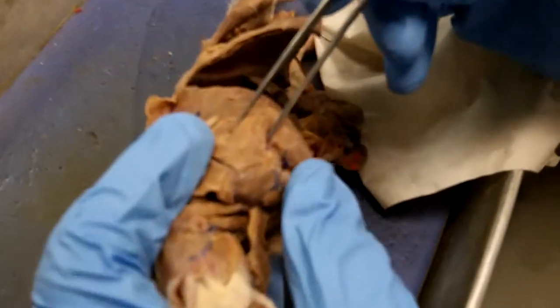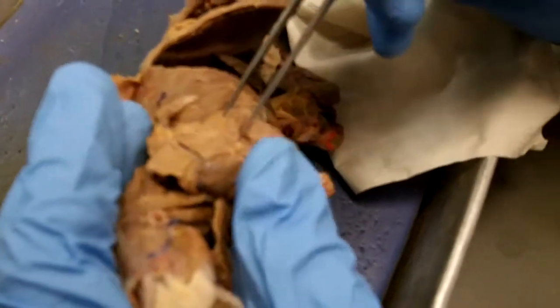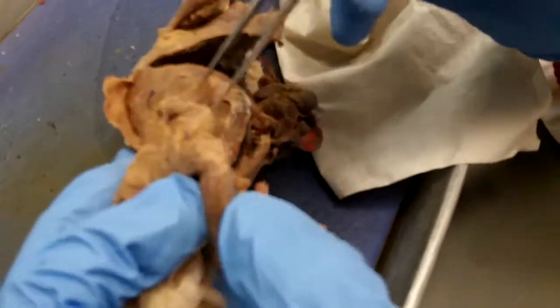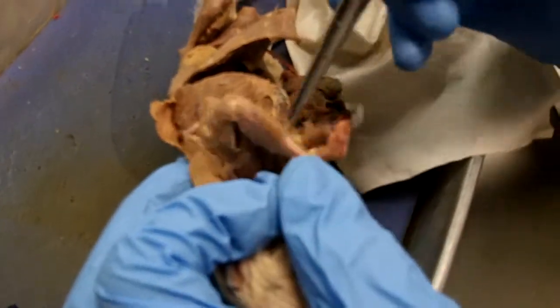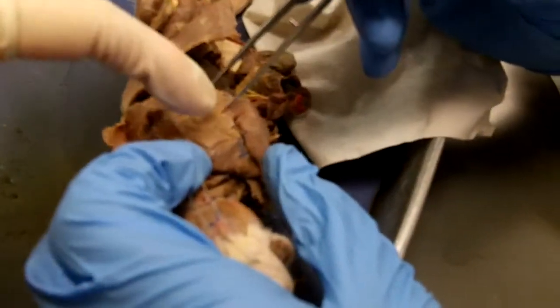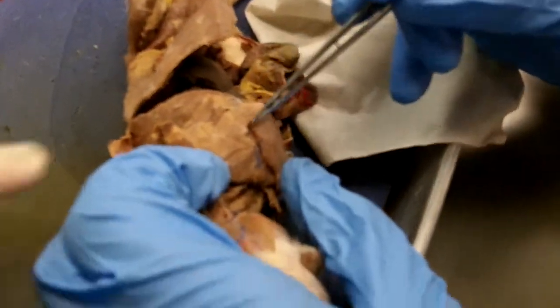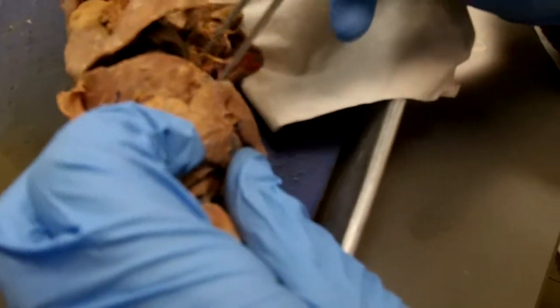But that's divided into two, right? Cutaneous trunci is the top one? No, the cutaneous trunci has usually been cut off. So this is clearly on the arm. That's all one muscle right there? It looks like there's a division right there, like one's on top and one's underneath.